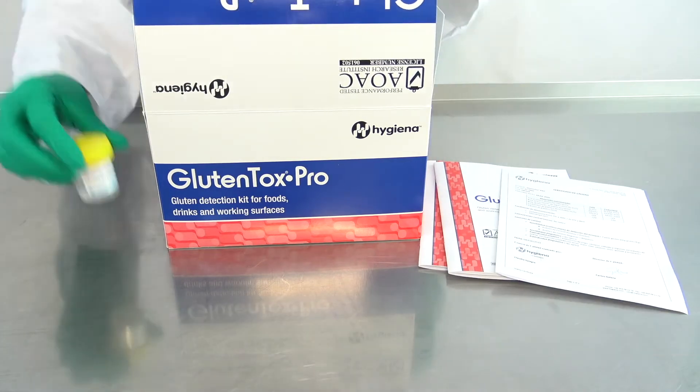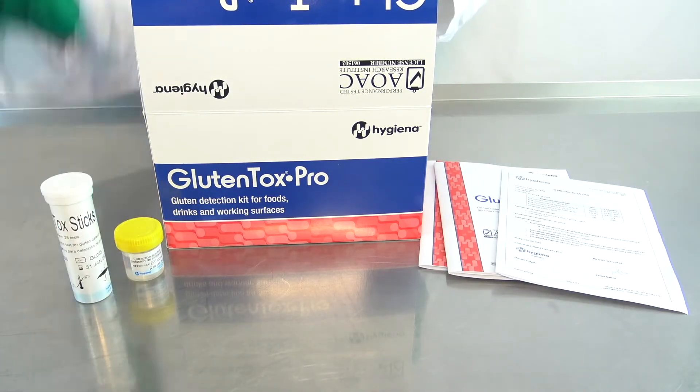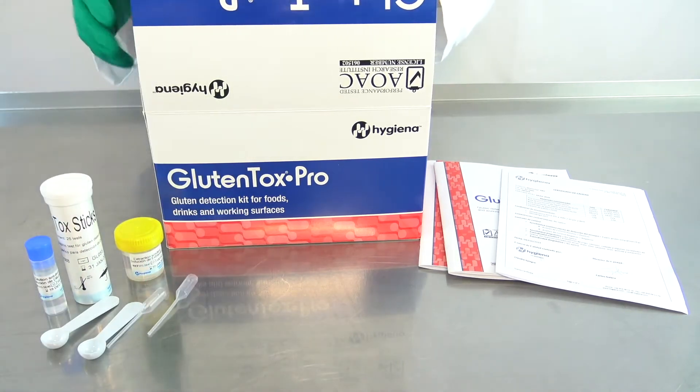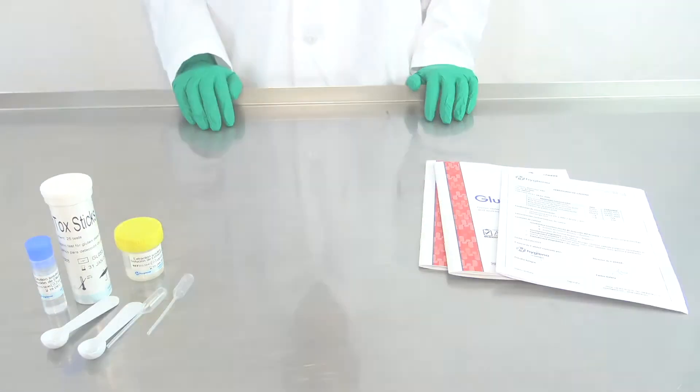extraction solution with a yellow cap, GlutenTox sticks, dilution solution with a blue cap, disposable spoons, and plastic pipettes. Let's get started!